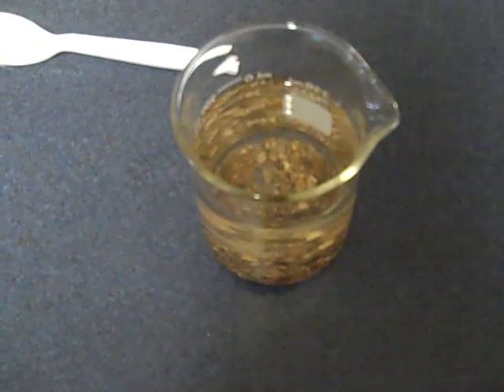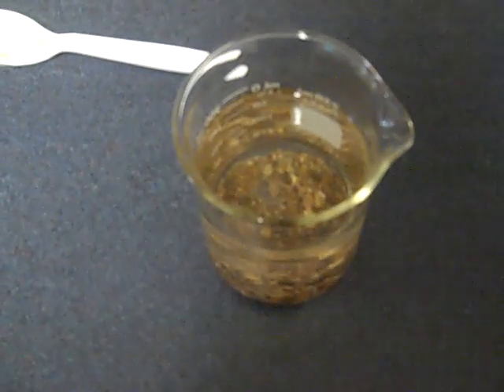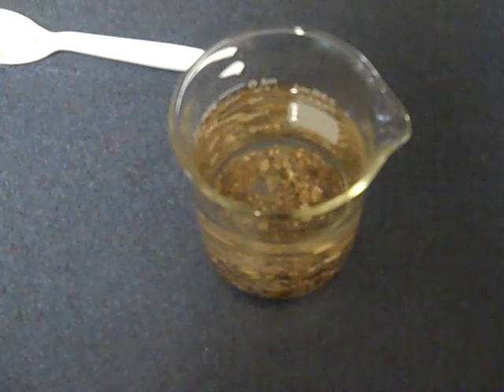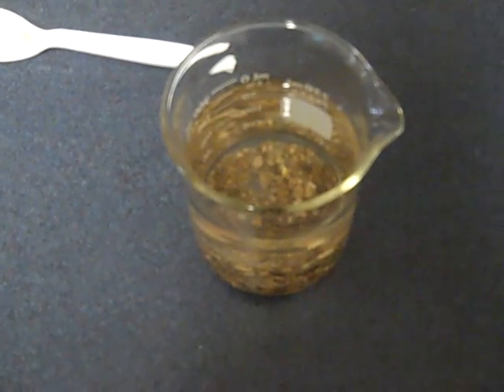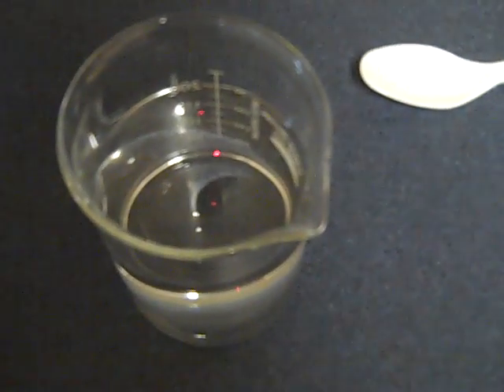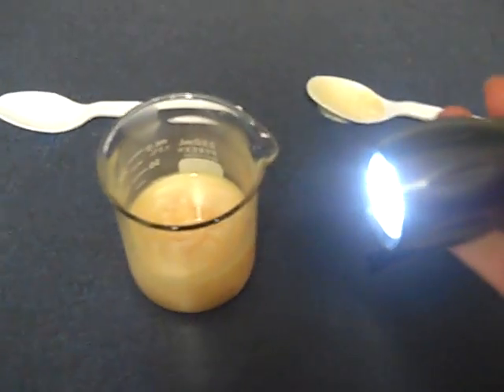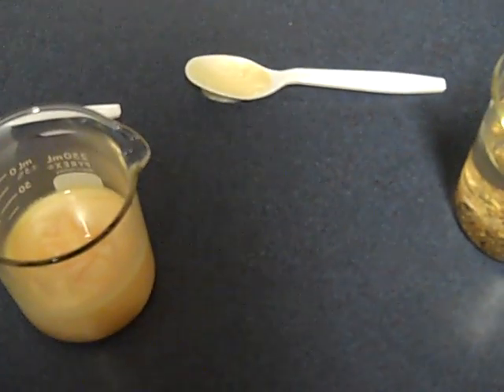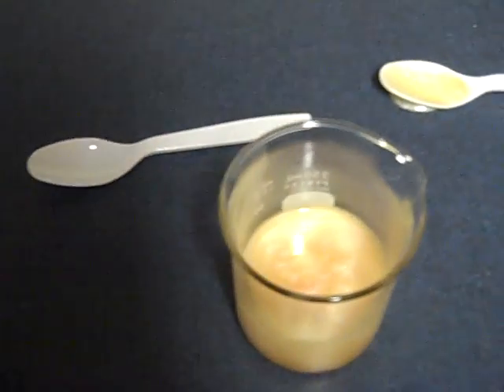In this video I'm going to be explaining the Tyndall effect that can be used to find the difference between a suspension, a colloid, and a solution. For the Tyndall effect you need a flashlight with a bright light, but each of these beakers has recently been stirred.